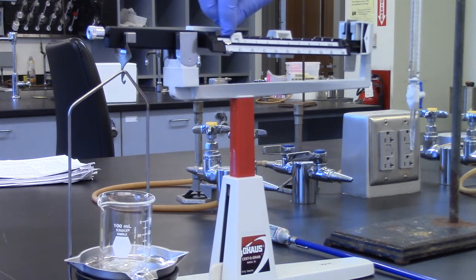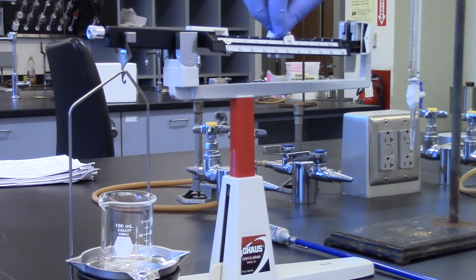Once zeroed, weigh the clean, dry, 100 milliliter beaker empty.